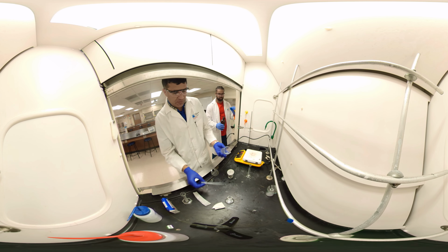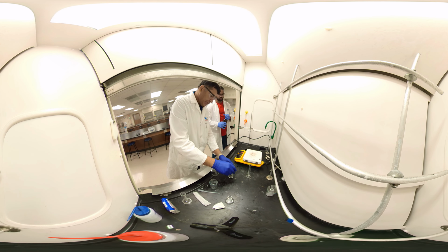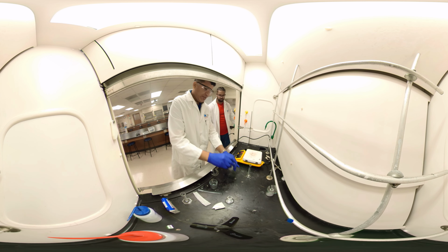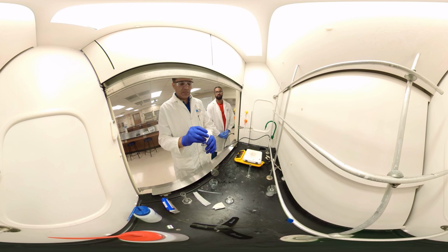A little bit left is just part of the error. So we just filter it here. Just filtering. I see some solid, which is good.